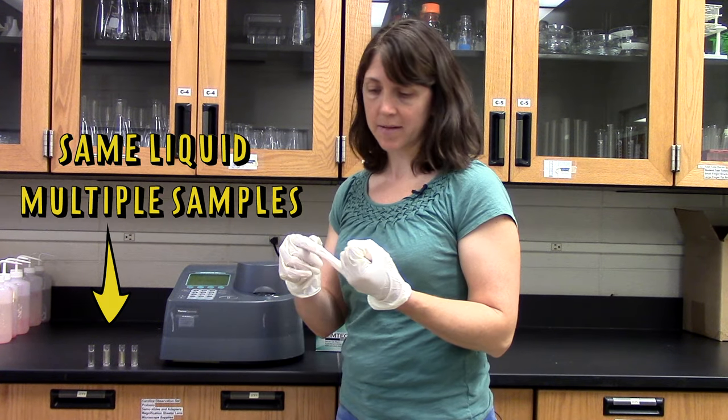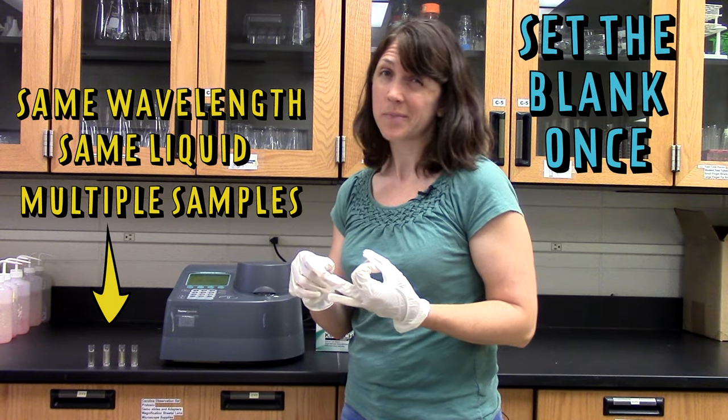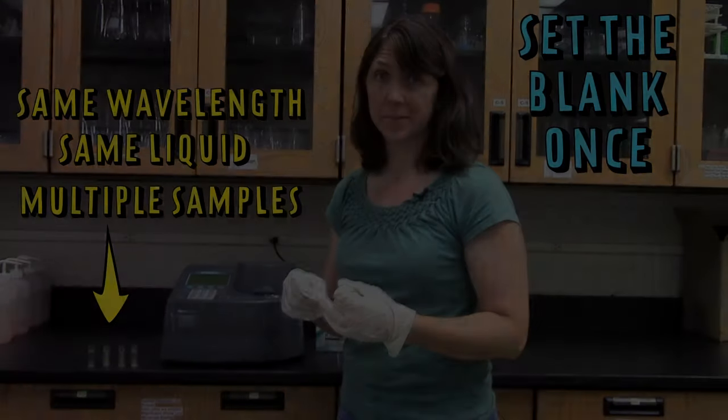If you have multiple samples that are in the same kind of liquid and you're measuring at the same wavelength, you only have to set the blank once at the beginning.